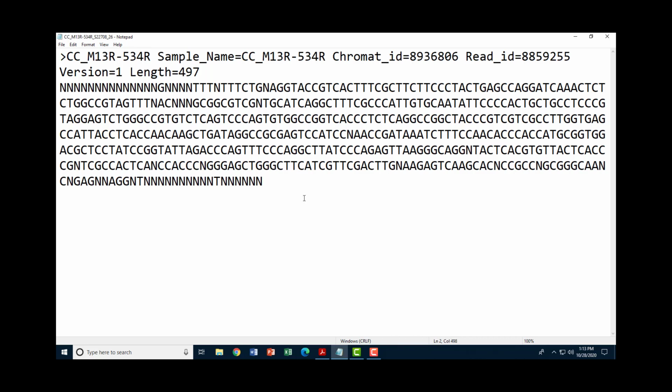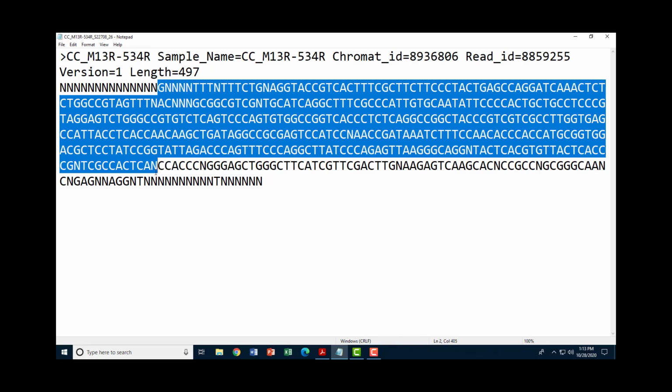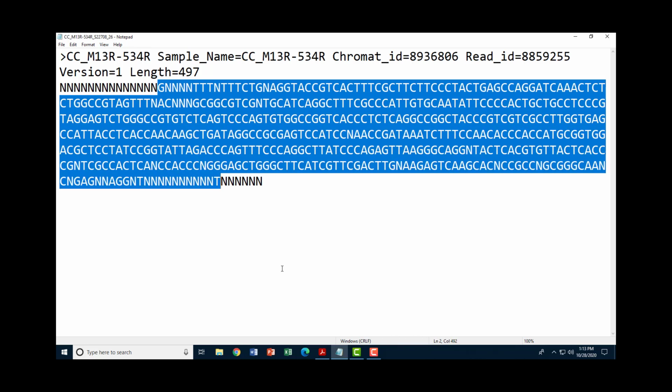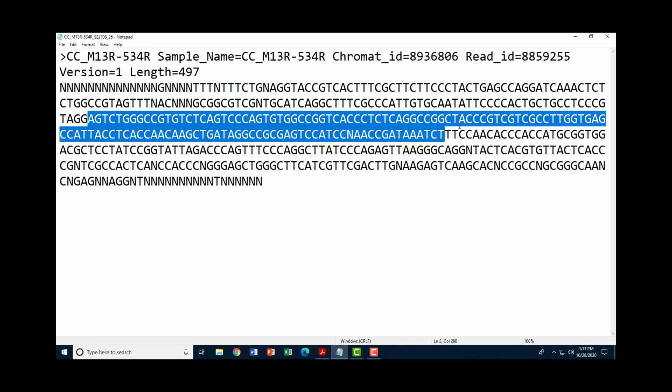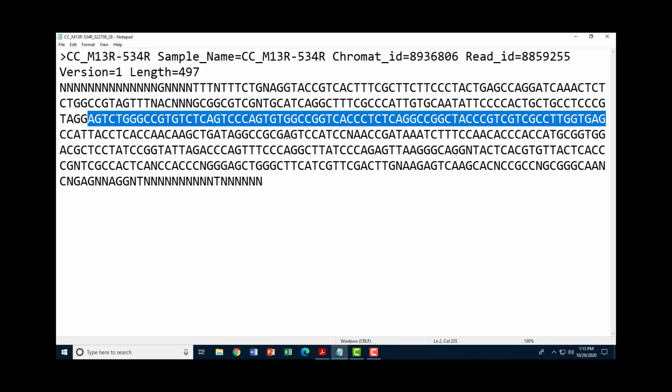Now, there's a couple of ways to deal with this. The first thing we could do is we could simply trim off the beginning and end sequences, and then cut and paste the remaining sequence and put it into BLAST for a BLAST search. And it would probably work fairly well, at least with this sequence, because we have a lot of continuous identified bases without any Ns in there. And the more we have in sequence without any Ns, the better our chance of finding a homology to a known sequence in that database.